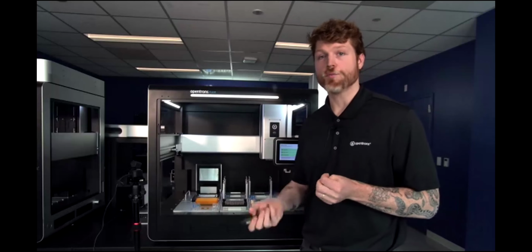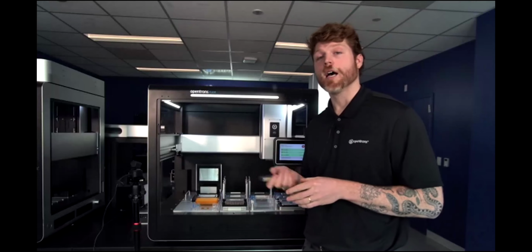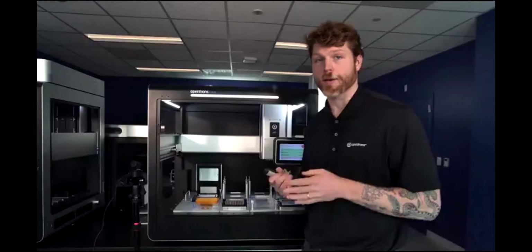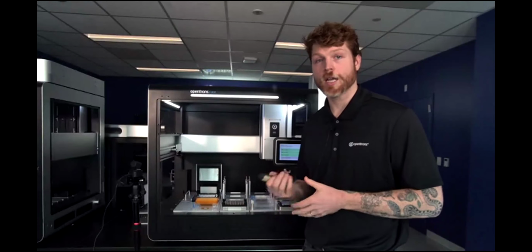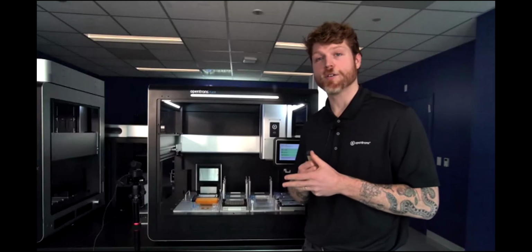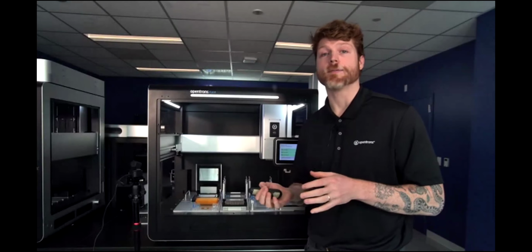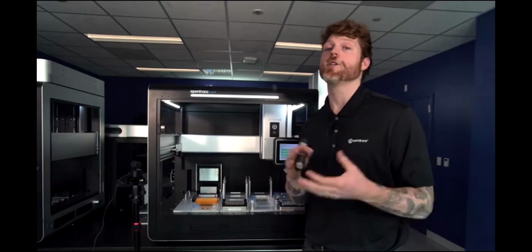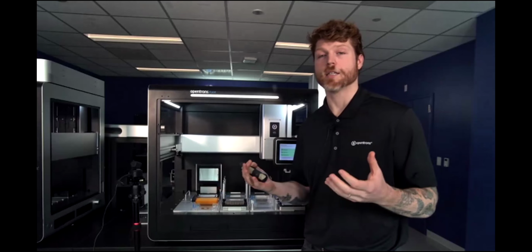The second new piece of hardware that I'm going to touch on here, as you can see in the back of our robot right now, which will be moving soon, is the Flex 96-channel low-volume pipette. There are obvious benefits to using a 96-channel pipette to scale your throughput, and this one now supports lower volumes as compared to our previous pipette, as you could probably assume by me calling it the low-volume pipette. And this supports volumes from 1 to 200 microliters, which is ideal for most NGS prep protocols across the space.